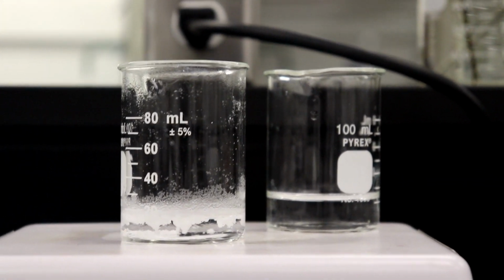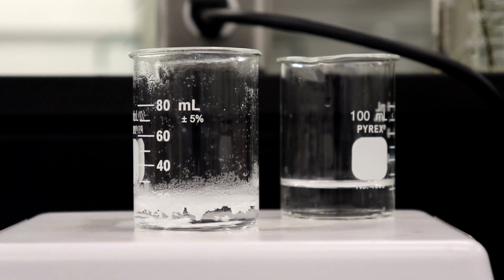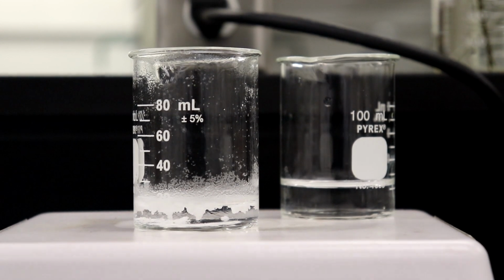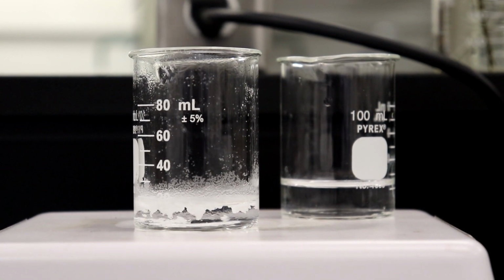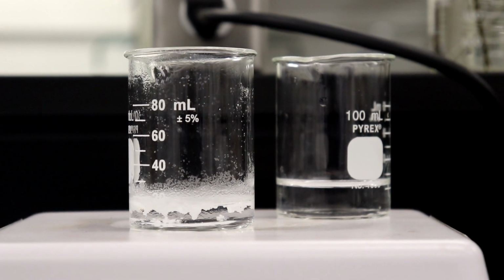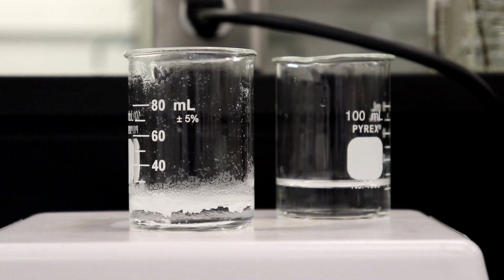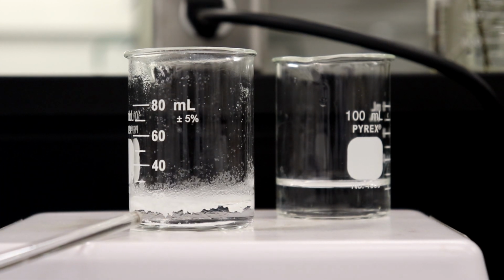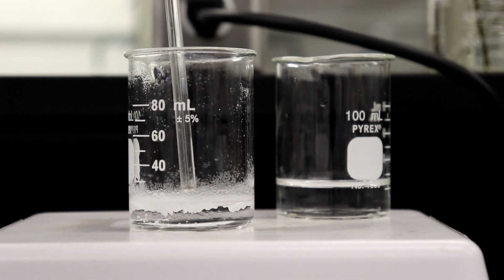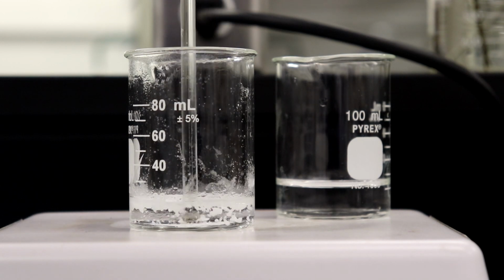Let's hope no one gets motion sick easy with me moving the camera around all this. So we're basically just waiting for this to start to boil, and we're hoping that our crystals begin to dissolve off over time. If we look down here at the bottom, we have a lot of crystals floating up to the top, and I can basically just push them down a little bit and break them up.